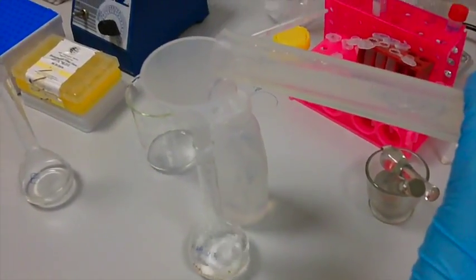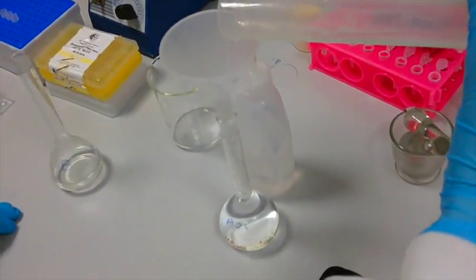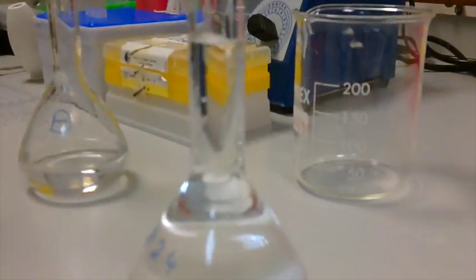If you've measured correctly, the volume should come right up to the mark as shown.